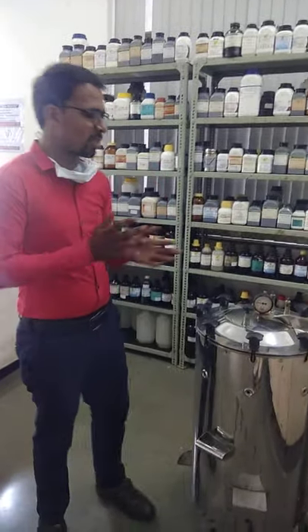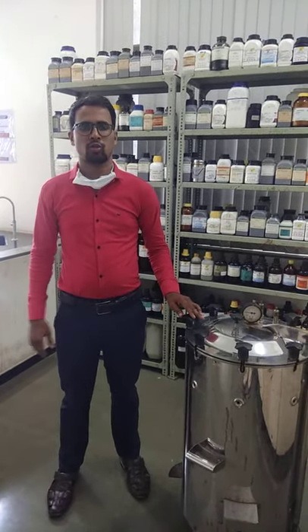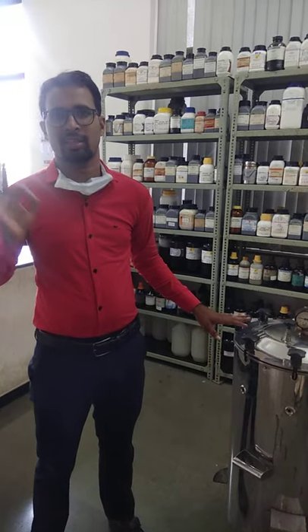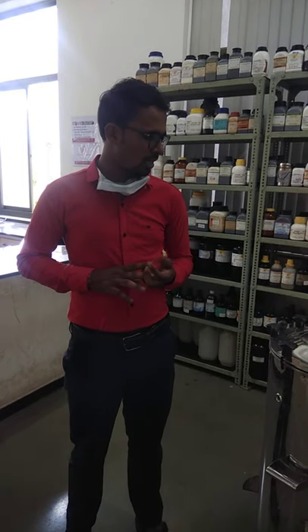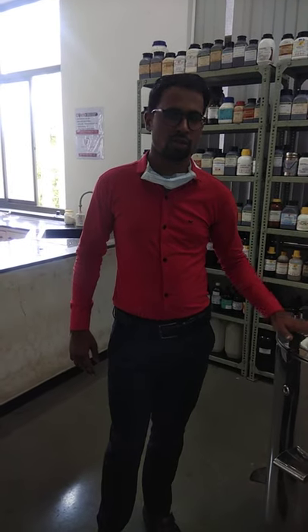The next instrument is the autoclave. This autoclave is useful for sterilization. The basic principle of this instrument is moist heat sterilization — under pressure and by using a specific temperature as well as pressure, you are going to sterilize your different apparatus as well as different media that you have prepared. So using this instrument you are going to sterilize your sample as well as your apparatus.